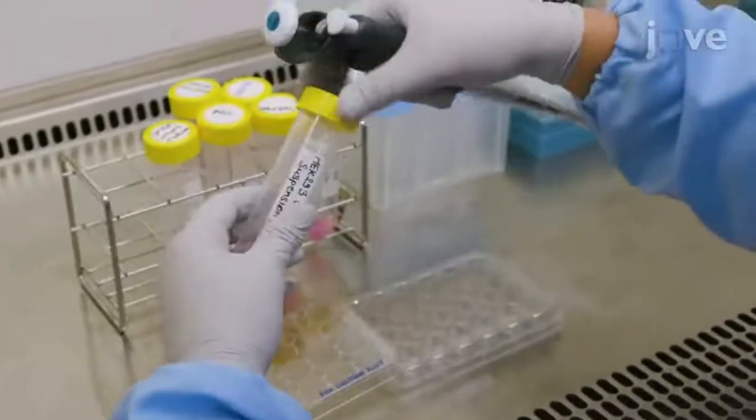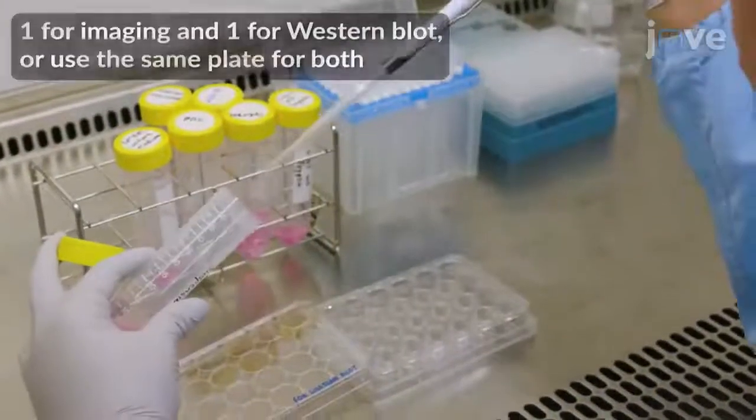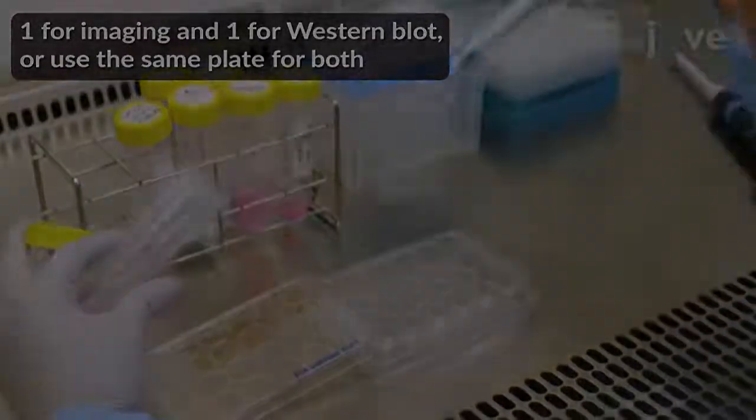Before transfection with SINEUPs, seed cells of interest on poly-D lysine-coated 24-well plates as described in the manuscript.